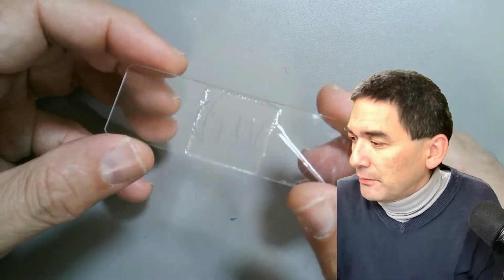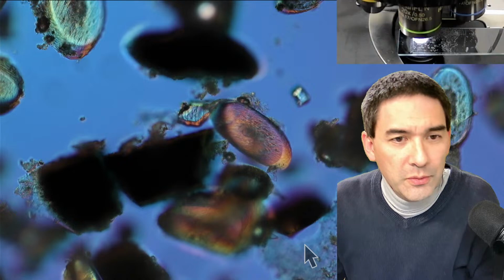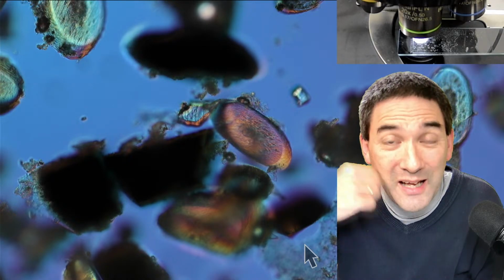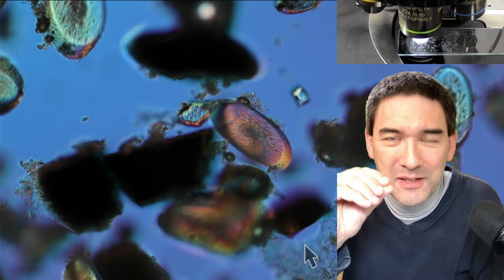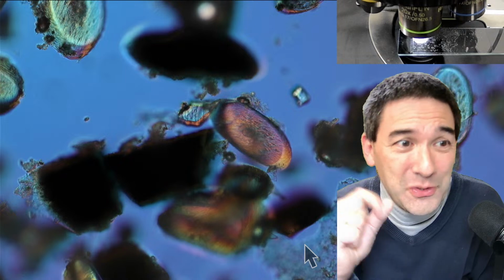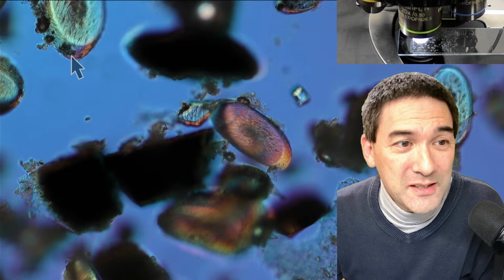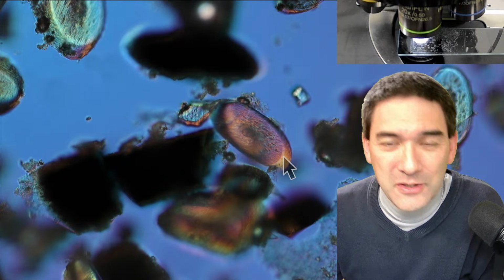Let's just have a look at this first, because there are a couple of interesting things here as well. So I'm going to go again to the scope view. For those of you who just joined in, what you see here is from the morning today when I had a shave. So I collected the beard, right? So you see that essentially you could do a calculation and measure out maybe how many fractions of a millimeter the beard grows every day. You see over here, that's the amount since yesterday, right? So that's something one could measure out.